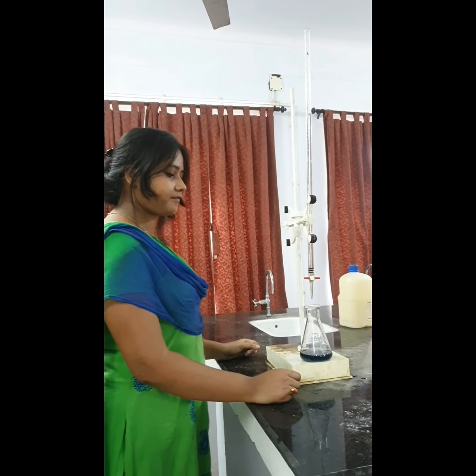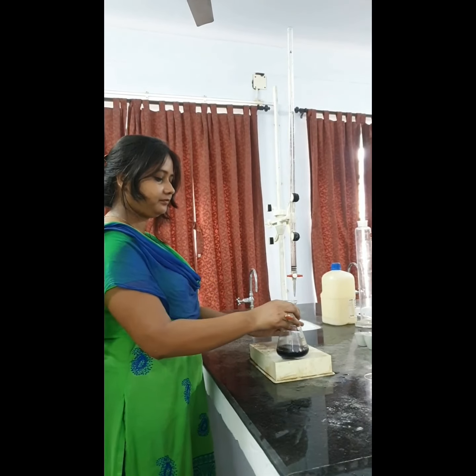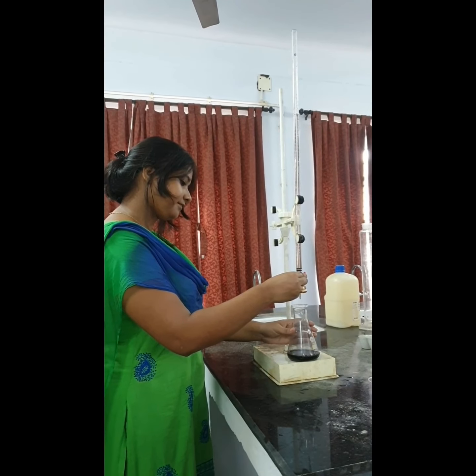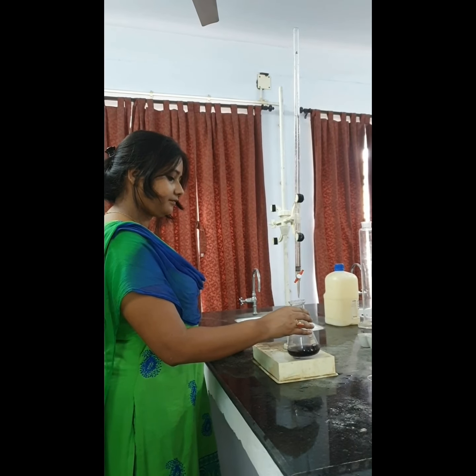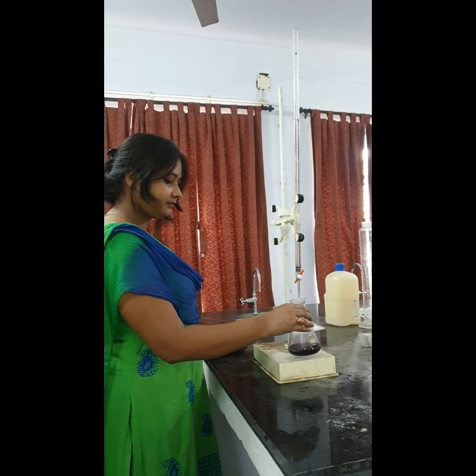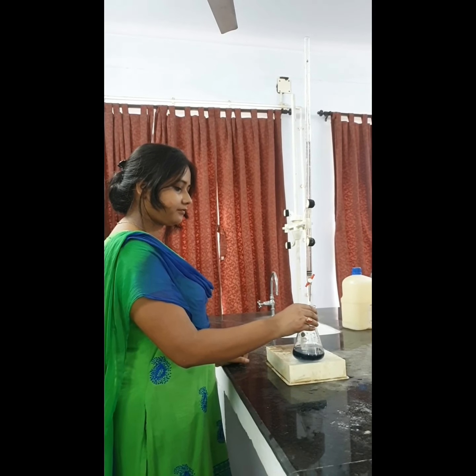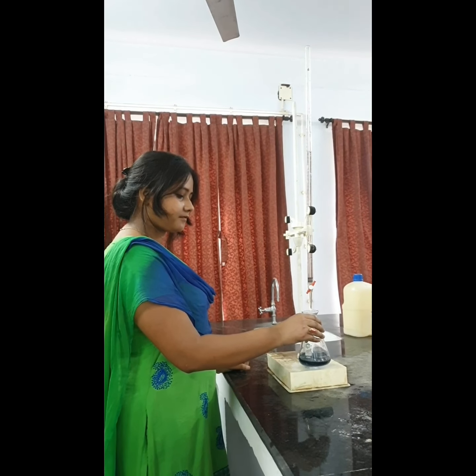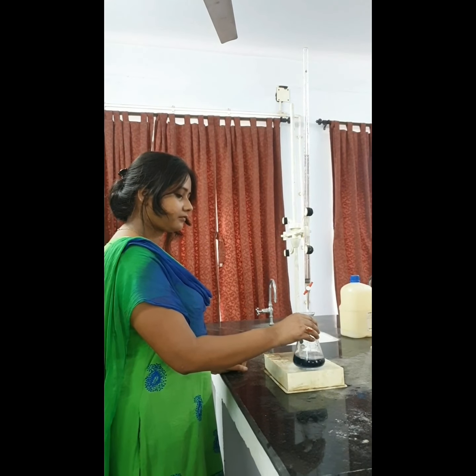Similarly, we will perform the test for the blank. Madam has taken the distilled water with EBT indicator, and we will do the titration for the blank also. See, the titration has begun for the blank. Some small movement has to be given to the blank so that the color changes. It will take a minute's time, and then we will get the desired color. Now the blank, that is the distilled water mixed with EBT indicator and titrated against EDTA solution, has also turned into blue color. So we have got the desired end for the blank also, wine red to blue color.